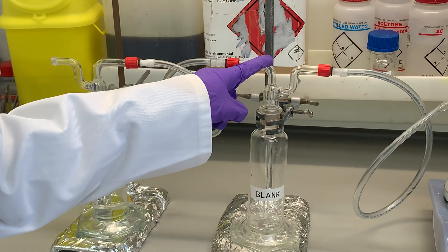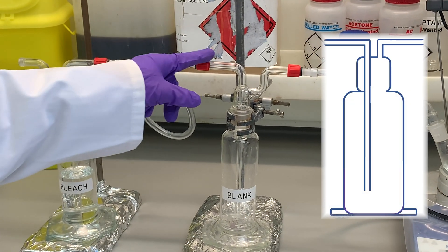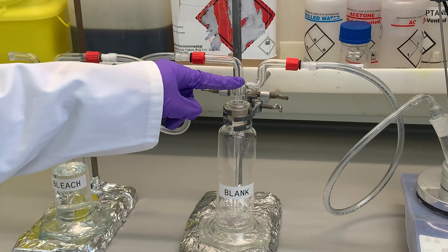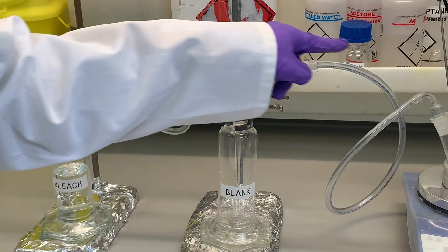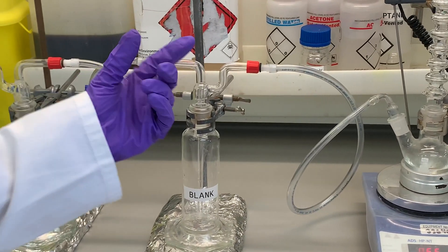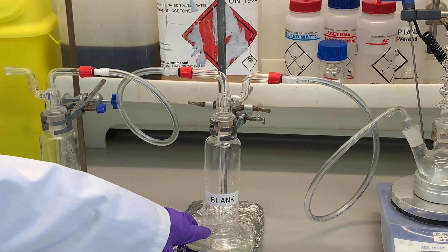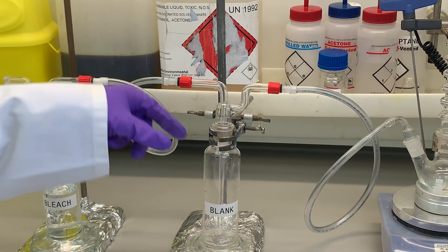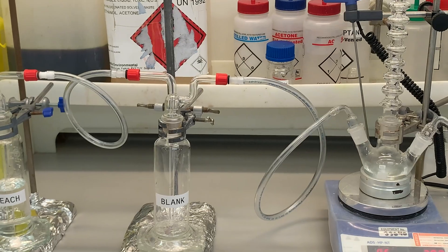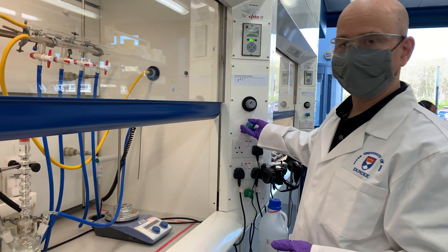On the sacrificial chamber the orientation of the head should be in the opposite direction. This means that any liquid that comes back through into this chamber must fill the bottle all the way to the top before it can go back through the tube and potentially back into the reaction. If it was set up in the other direction it would be much easier for liquids to be sucked back into the reaction.